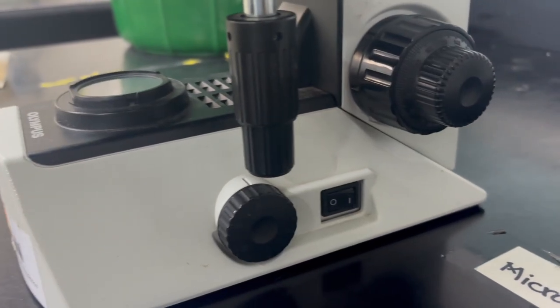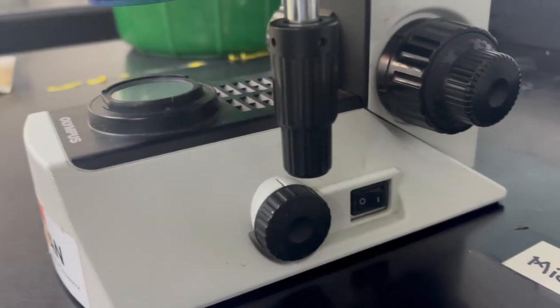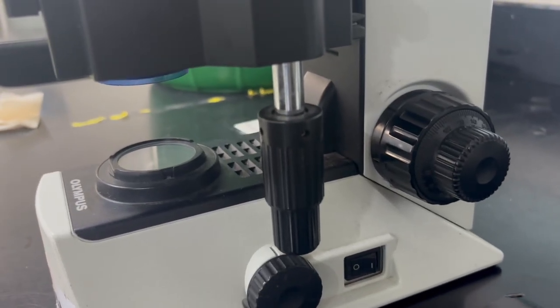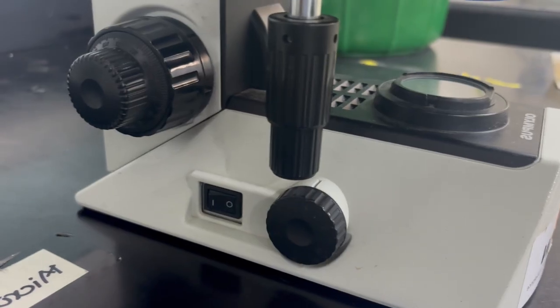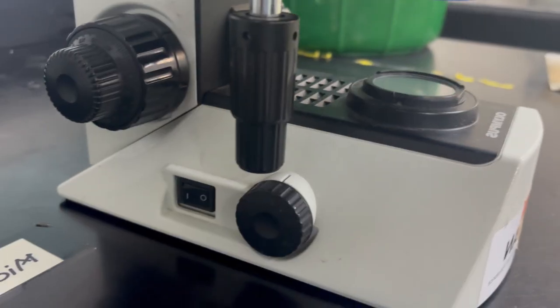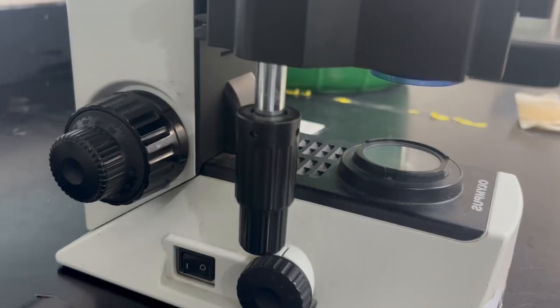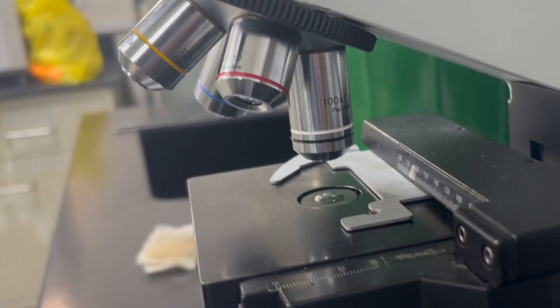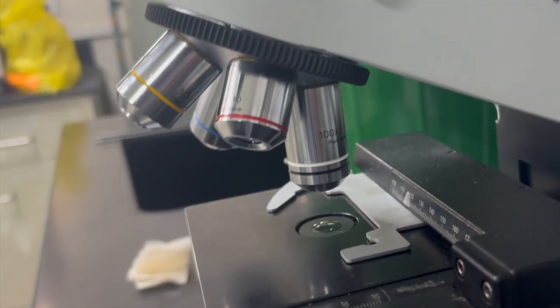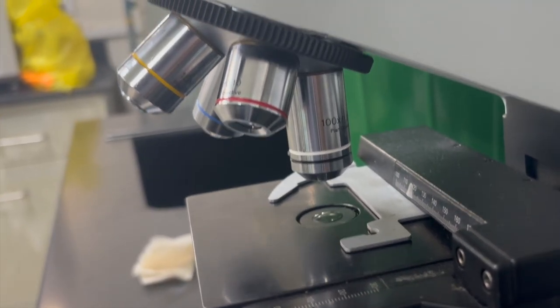So a typical process you follow when trying to view a specimen through a microscope is you turn on the microscope. Then you can look for the light source and either decrease or increase it. Generally, it should have been turned down when the previous person used it or when you used it. So you go ahead and increase the light. So once you've increased the light intensity so that you can see, you can go ahead and place your slide on the microscope.